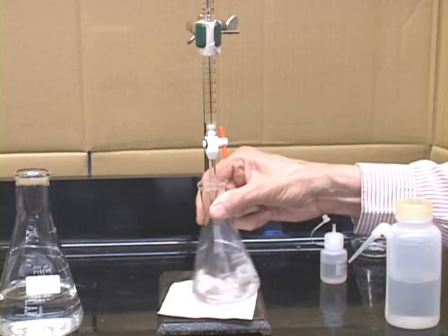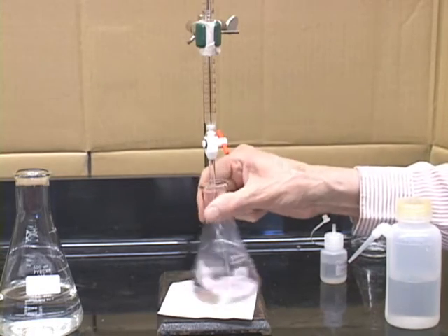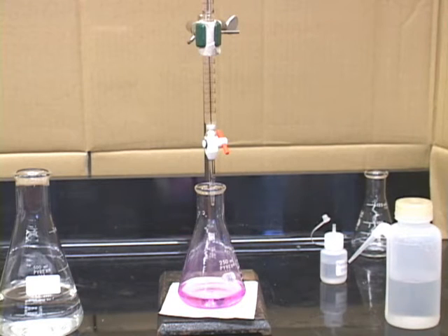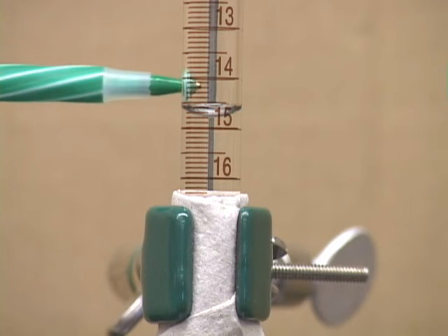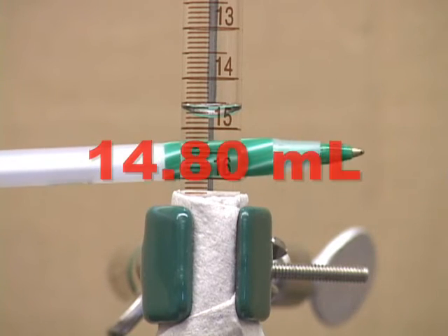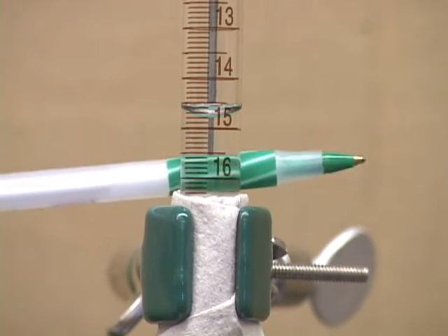Each drop then will make a pink color here, and then 1 drop makes it a permanent pink. And at this point then you will read the burette. Here's the final reading on the burette, and as you can read, it reads down, remember, 14, 14.5, 6, 7, 14.80, and as you notice, the meniscus will change a little bit as the background color changes here.